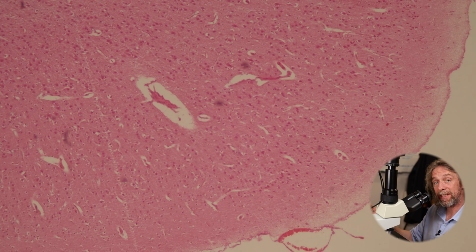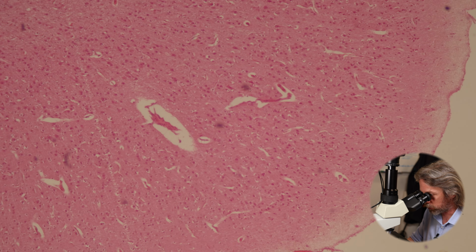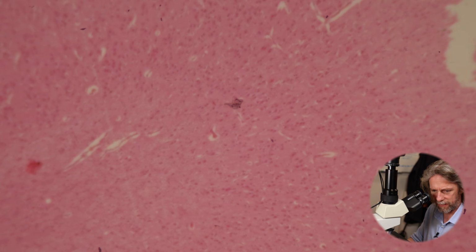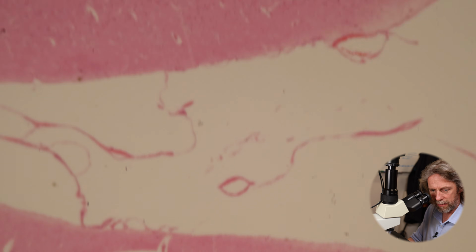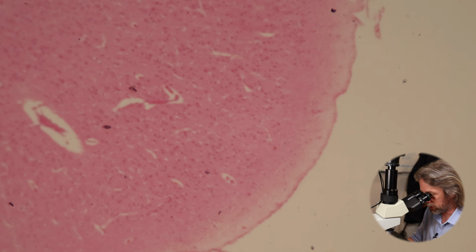And that's one of the things about brain, is that in here, oh, that's a better bit, in here, there isn't any connective tissue supporting it. We're not finding collagen holding the brain together. That's why it's so soft, and it needs special support structures to help float it and hold it in place. Okay, how about that? Can you see that's a gyrus. That's a sticky outy bit. And there's the sulcus in between. So this is the surface of the brain.